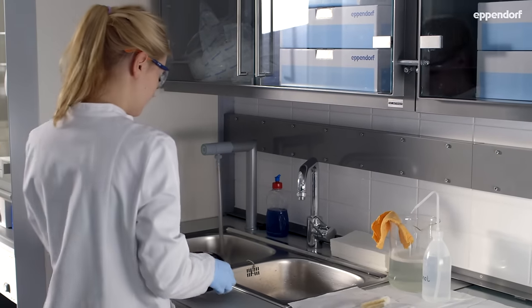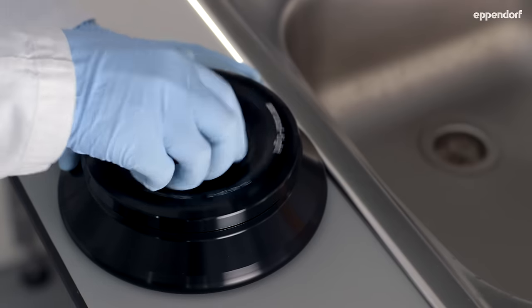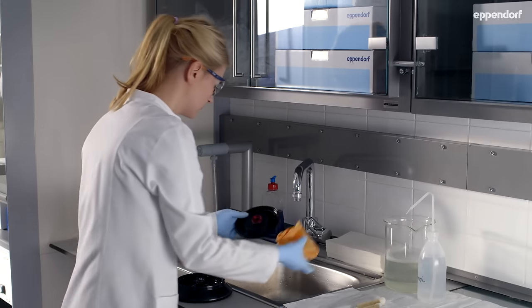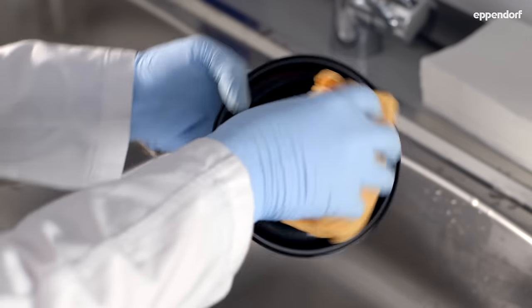Do so with the centrifuge rotors as well to completely remove salt and chemicals which may support the formation of corrosion.